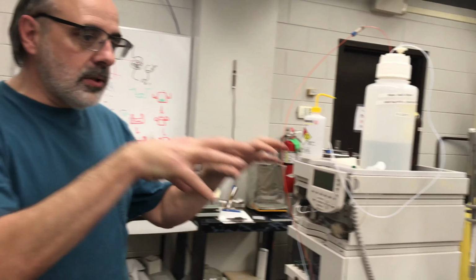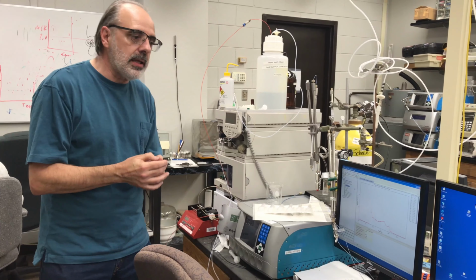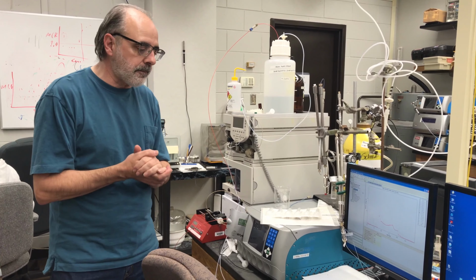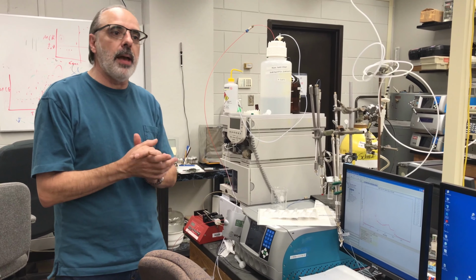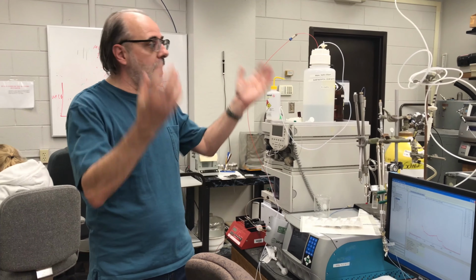With the detectors that we have here for a GPC, we can also do what's called batch measurements. That will be offline measurements of particles or molecular weight characterization of polymers. That will be in a batch mode, and on that we can do things like Zimm plots and Debye plots that will give you some other information. Okay, that's like the basics that we have here. We have some more things.